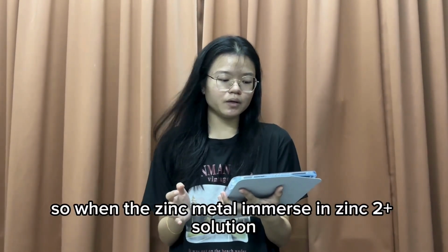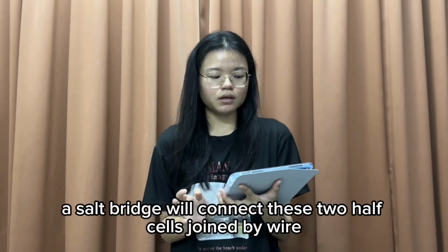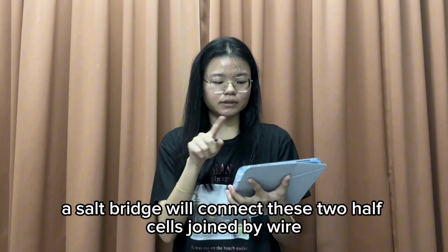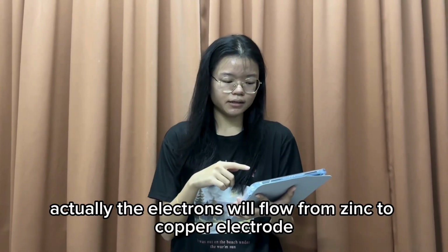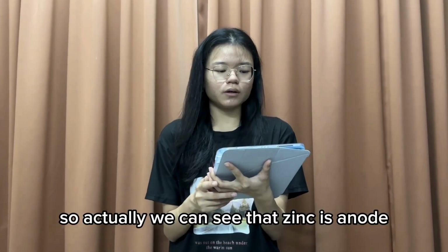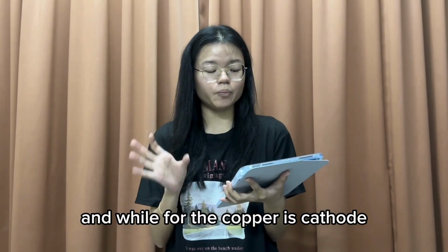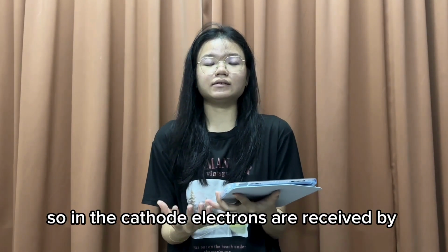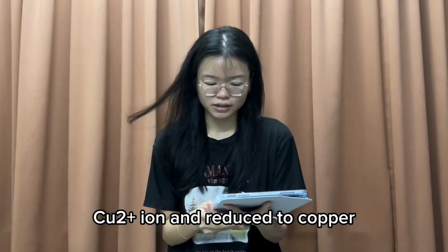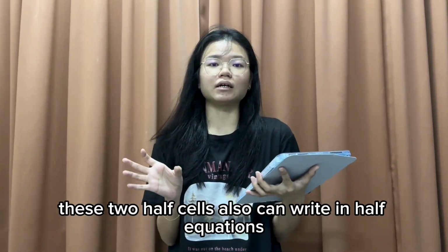When the zinc metal is immersed in Zn2+ solution and the Cu metal is immersed in Cu2+ solution, a salt bridge will connect these two half cells, which are joined by wires. The electrons will flow from the zinc to the copper electrode. So we can see that zinc is the anode, while copper is the cathode. At the cathode, electrons are received by Cu2+ ions and reduced to copper. These two half cells can also be written as half equations.